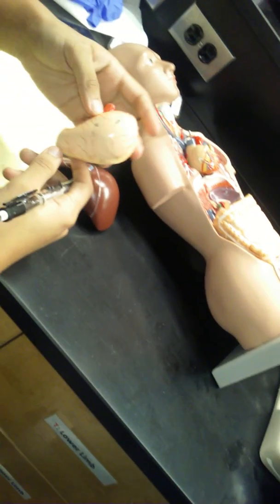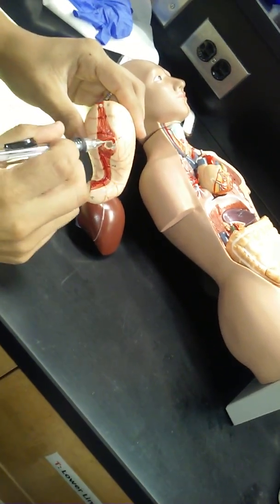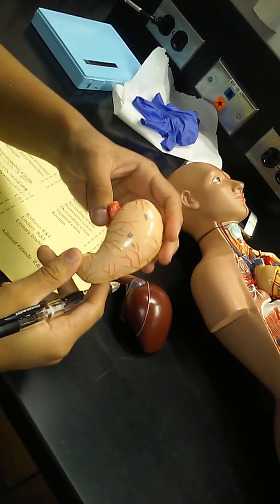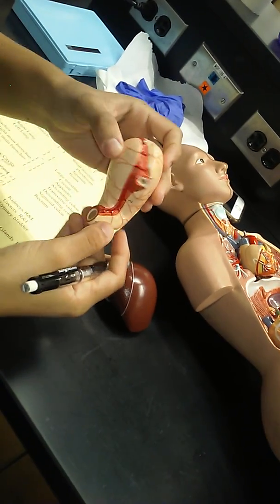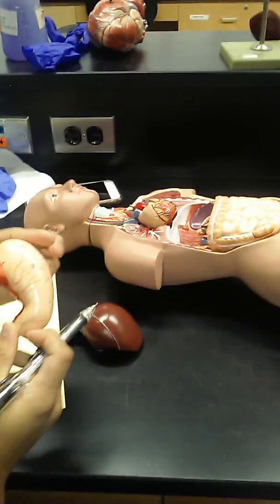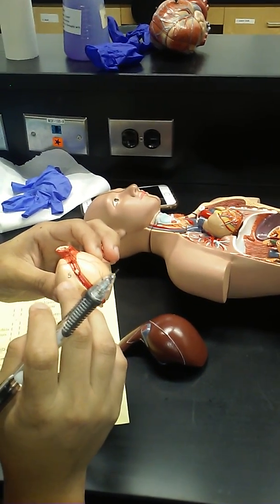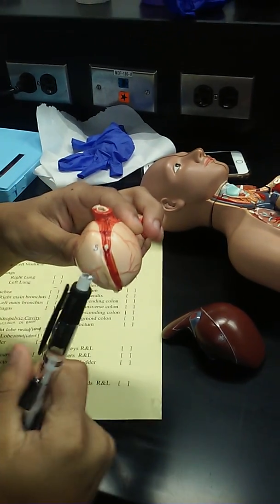Now, here's the entrance. Here's where the food comes down from your mouth, down through the food tube, and notice it enters the large part of the stomach over here. But the stomach gets narrower and narrower as it comes toward the exit. And here's the exit over here by the number 4. So this large bag-like area has a number 5 on it. That's called the fundus of the stomach. Fundus is the large bag-like area.